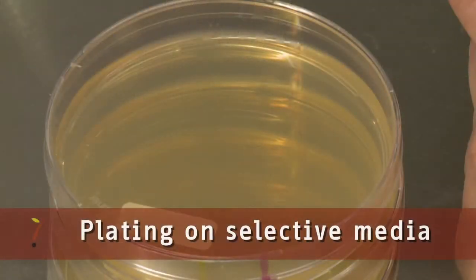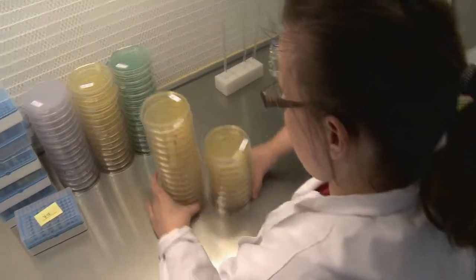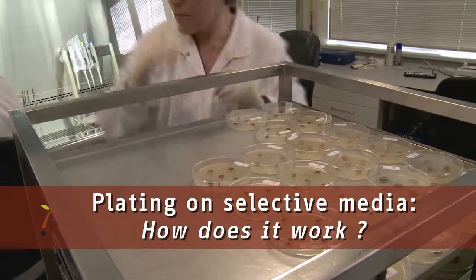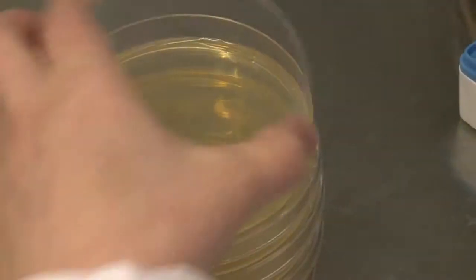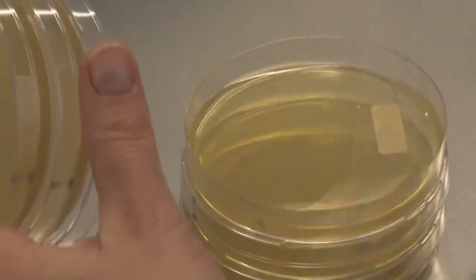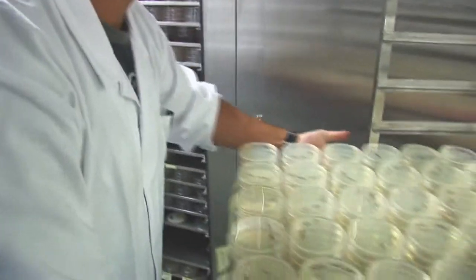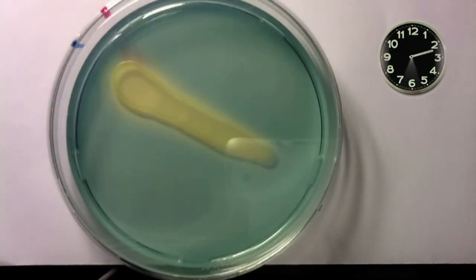Propagation material can be tested rapidly and with relatively low costs for the presence of pathogens using detection on semi-selective media. This method is predominantly applied in the detection of fungi and bacteria in seeds. The material or an extract of the material is distributed on a specific growth medium. Antibiotics are added to the growth medium to make it semi-selective. The antibiotics reduce the growth of undesirable bacteria, so-called saprophytic bacteria. This allows the target pathogen you want to detect to multiply unhindered.